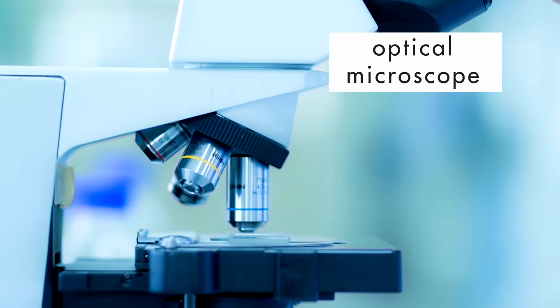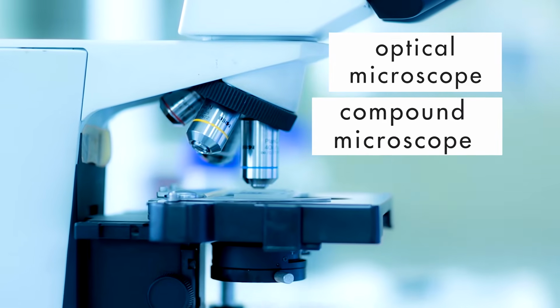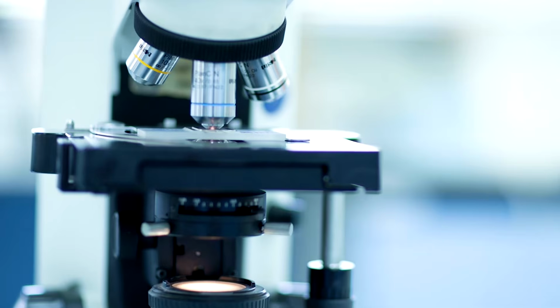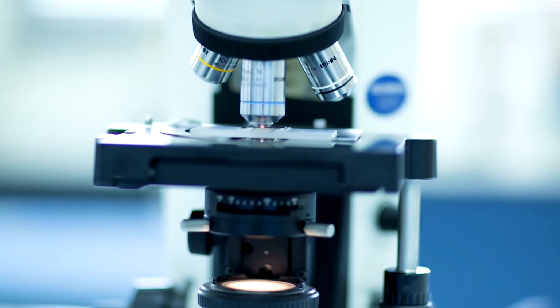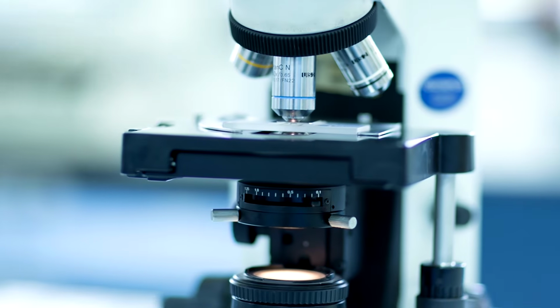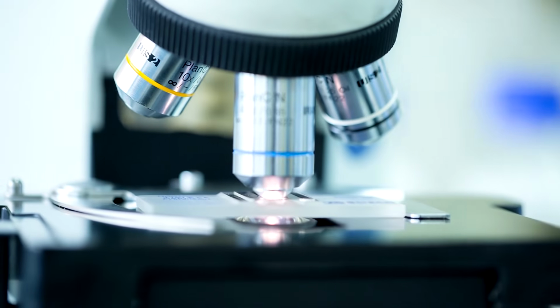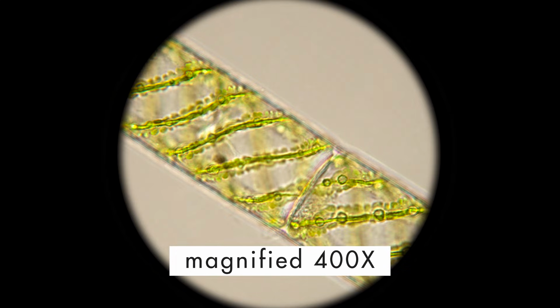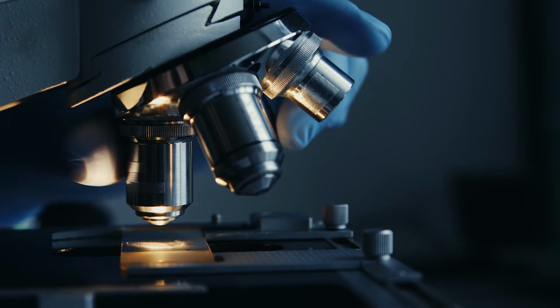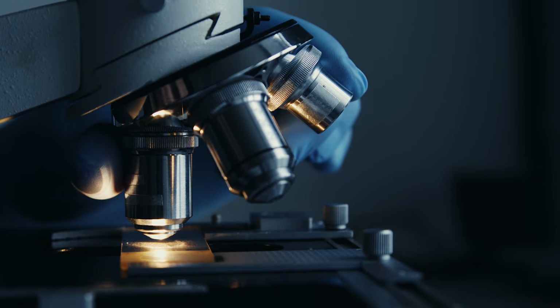The most common type of optical microscope used in high school and college biology classes is the compound microscope. With a compound microscope, an image is magnified when light passes through a very thin or transparent object and is focused and magnified by a series of lenses. Most student models of compound microscopes can magnify an image 40 to 400 times. But some professional instruments are capable of magnification up to 2,000 times.